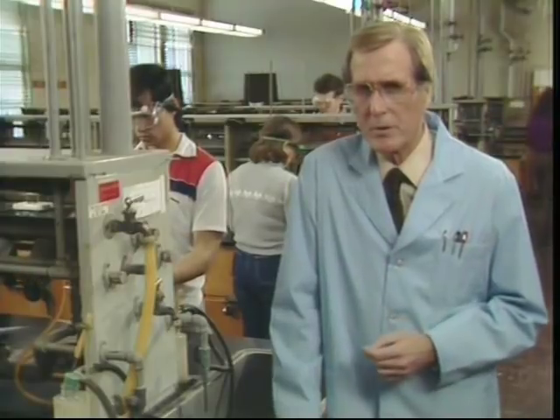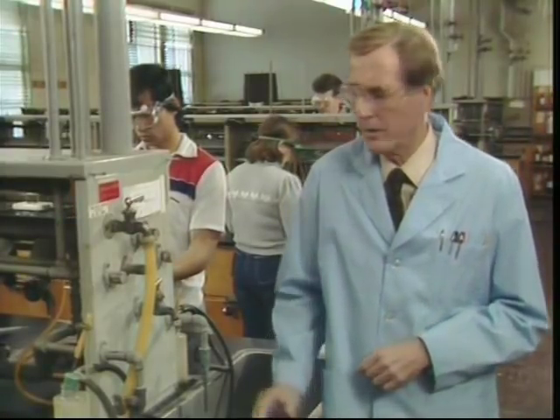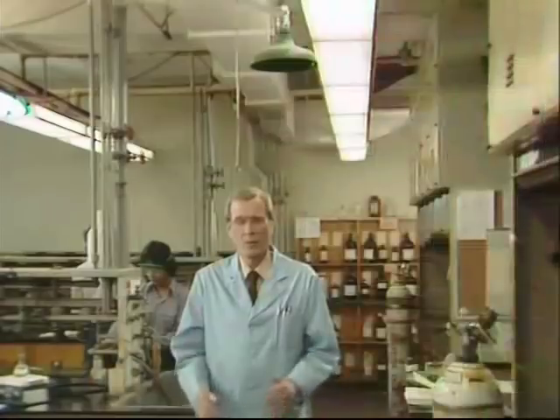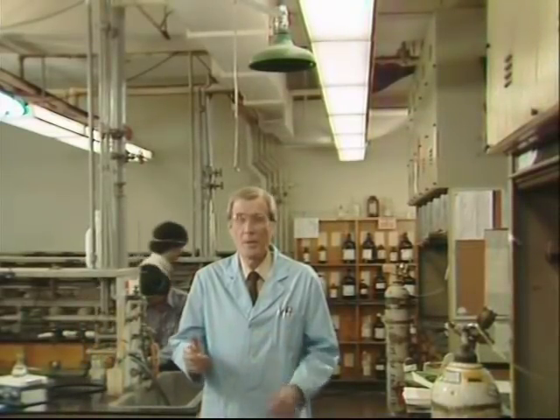Now, most chemical spills are small, and if the area of the body that has been splashed can be put under the nearest tap, well, this is by far the simplest and fastest procedure. However, if the spill is over a large portion of your body, say more than your hands, get under a safety shower. The purpose of the shower is to deluge the affected area. You'll begin to feel better fairly quickly. But don't get out of the shower.